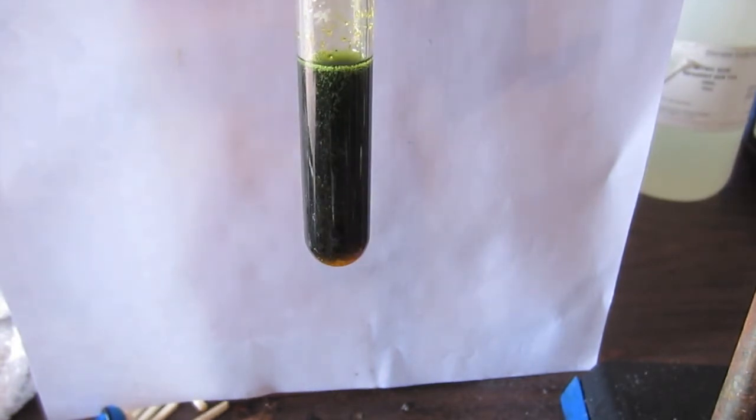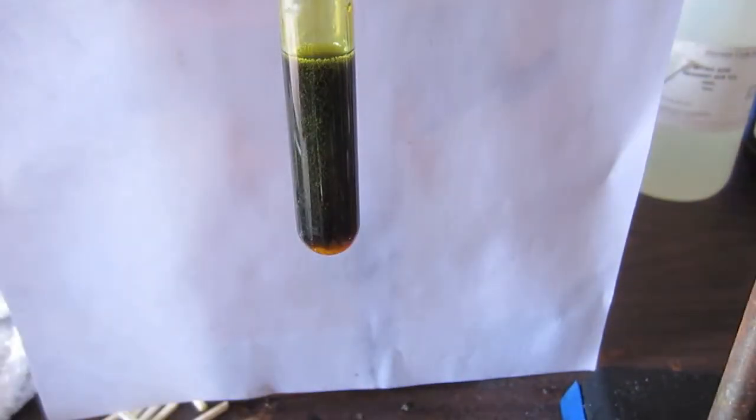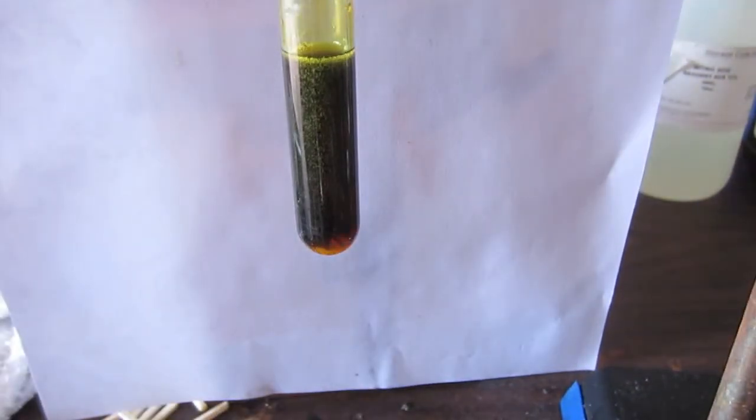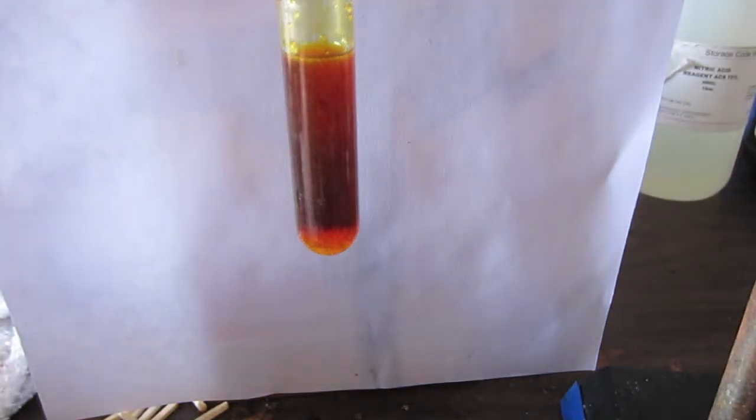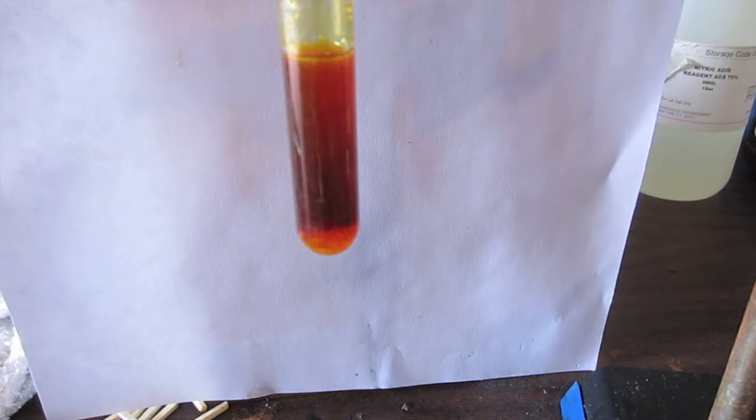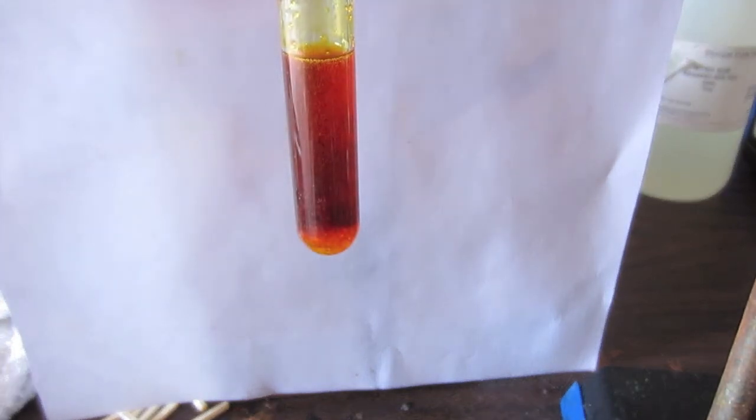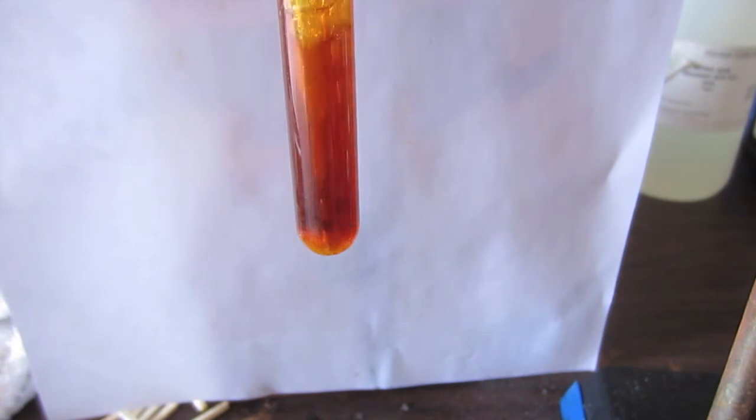What I am doing right now is adding sodium chlorate, a strong oxidizer, to the solution of vanadium plus 3 to slowly oxidize it, skipping plus 4 all the way to vanadium plus 5. I get a much stronger color in this reaction, which is why I am showing you this, although sadly I wasn't able to get on tape how I got the pure green. So there you can see the reaction is almost done, but when I actually stir it up with a pipette you see that the color gets much, much brighter. That's why I showed you this clip.